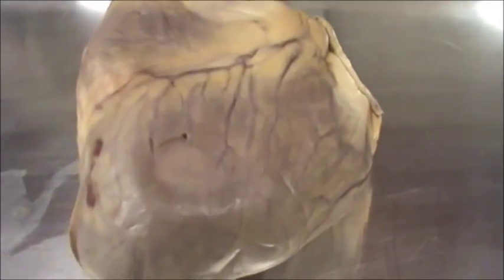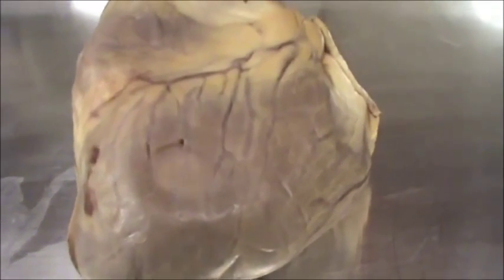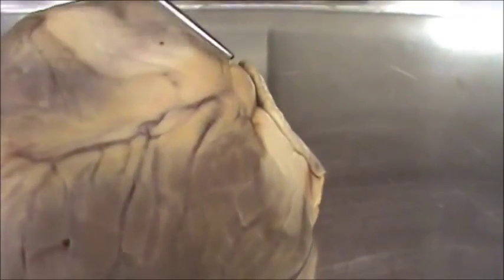Hello, today I am going to show the anatomy of the heart. First we will look at some external features of the heart. The pointed tip of the heart is the apex, and the opposite side of the apex is called the base of the heart.